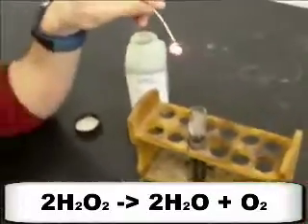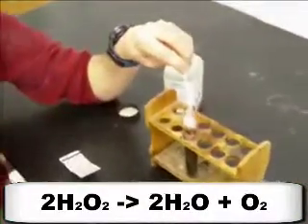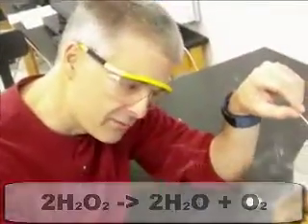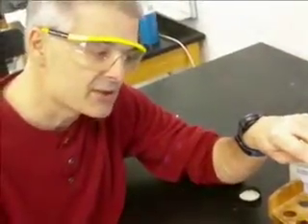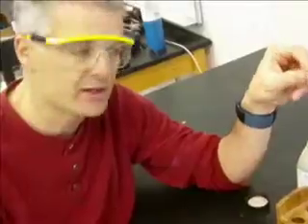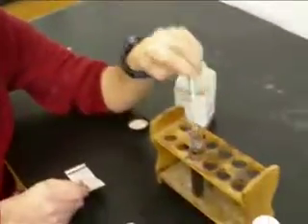Actually, this is a combination reaction and a decomposition reaction at the same time. We're decomposing the hydrogen peroxide to produce the oxygen gas, and as I produce the oxygen gas, we're actually having a combination reaction. Hydrogen plus oxygen makes water. So, pretty cool.